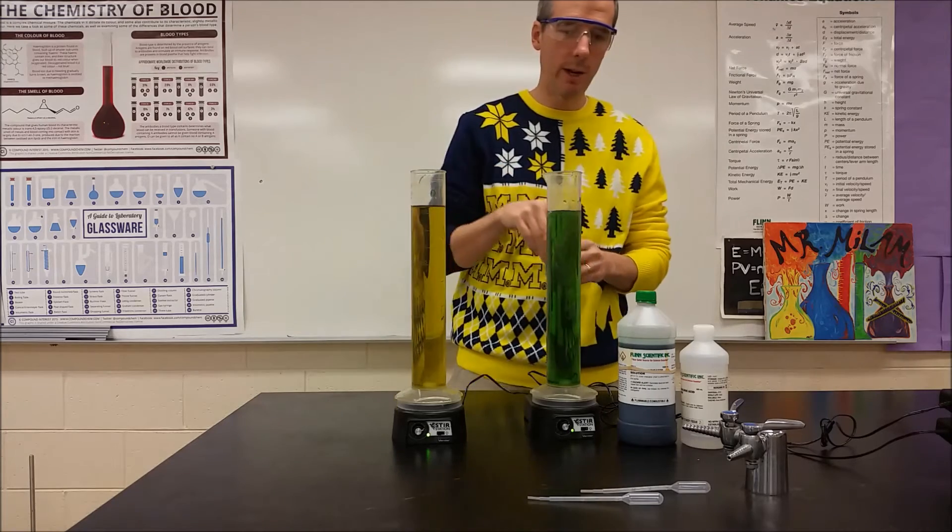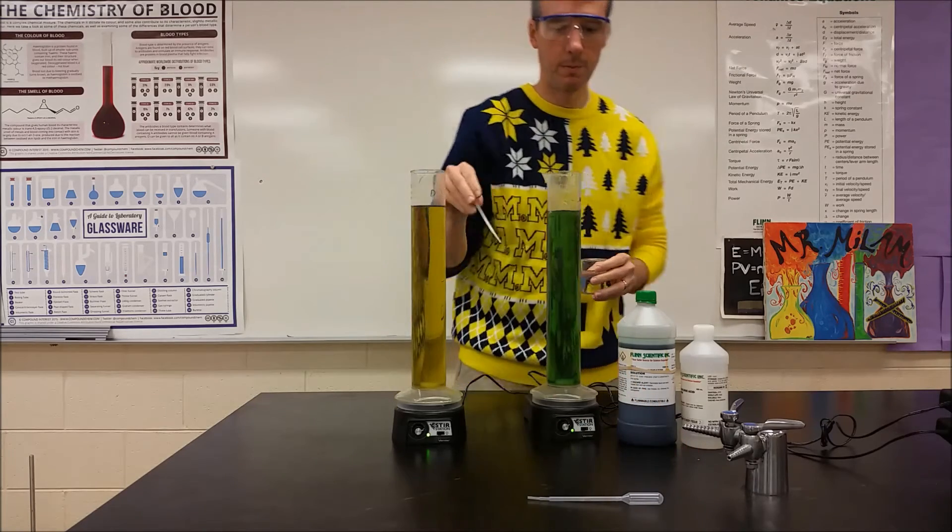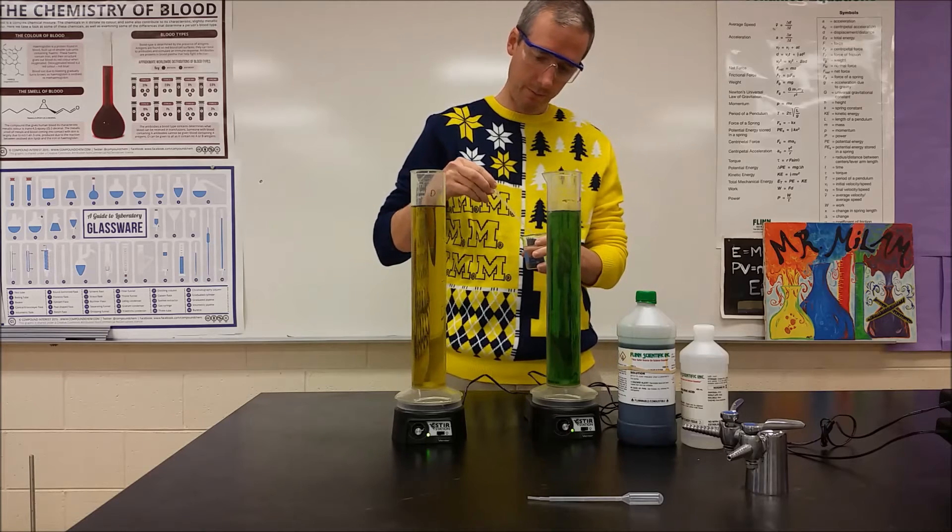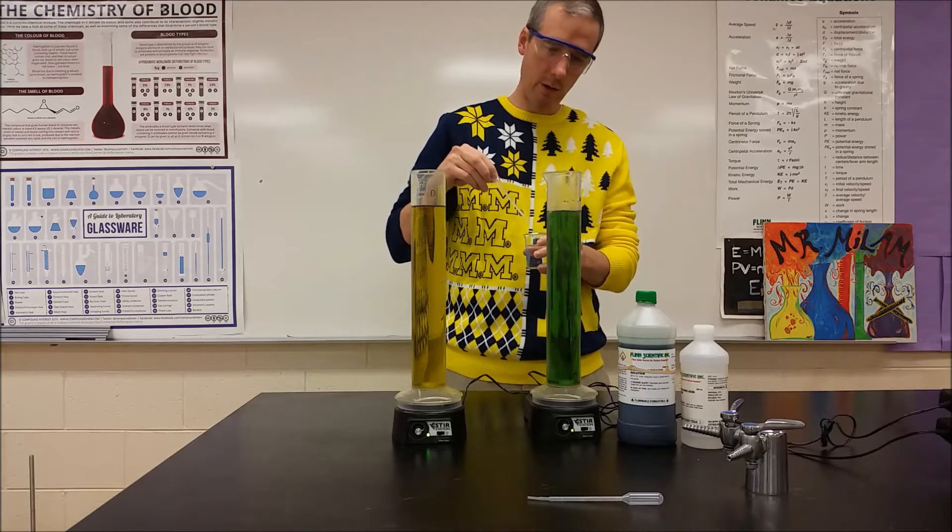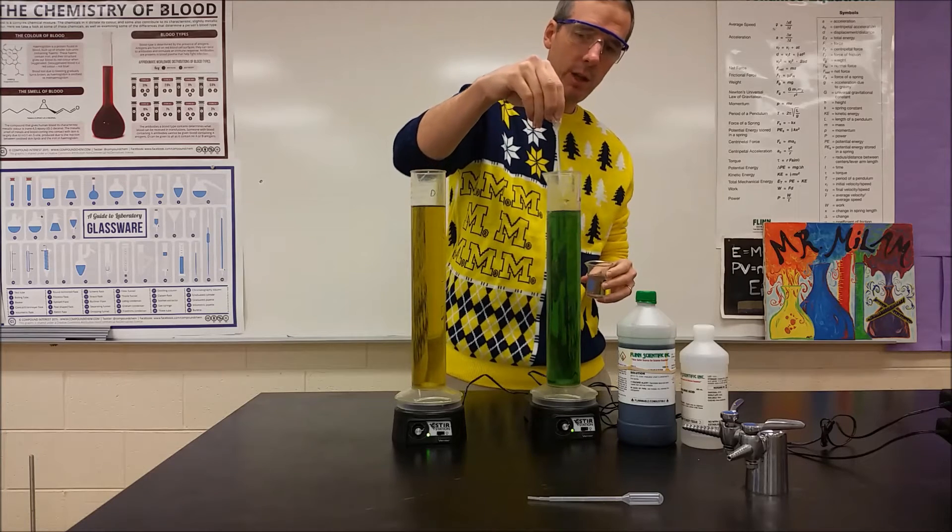What we're going to do is we're going to add a dilute acid solution to each, little by little. So first I'm going to add a milliliter to the tap water.